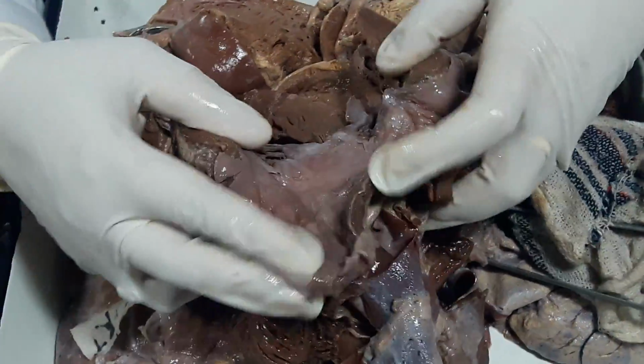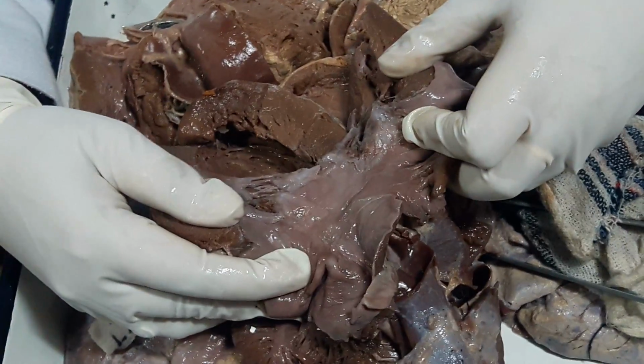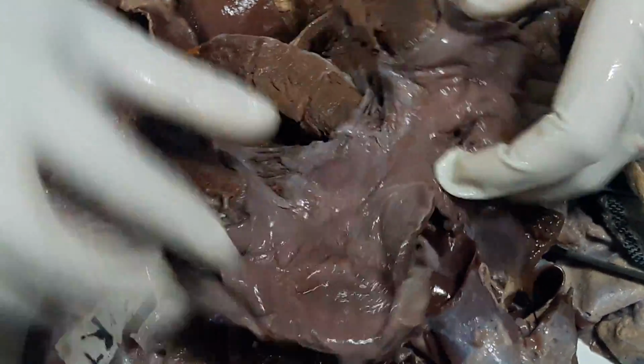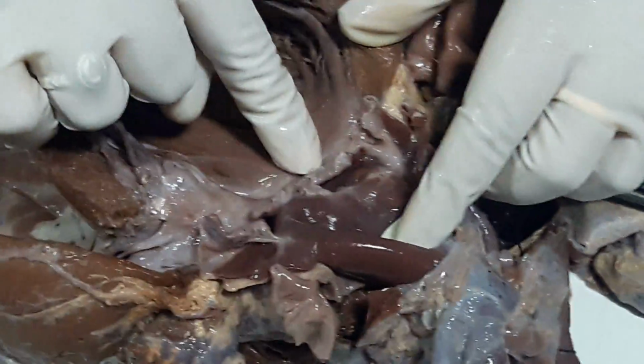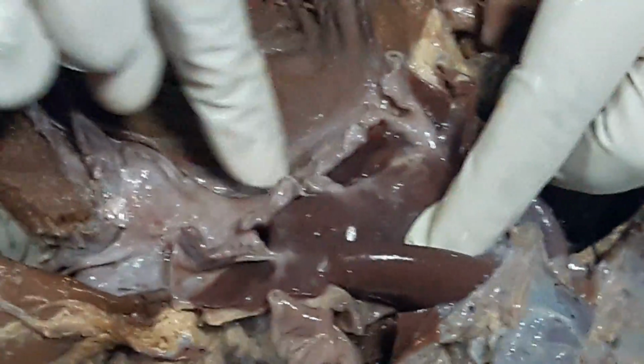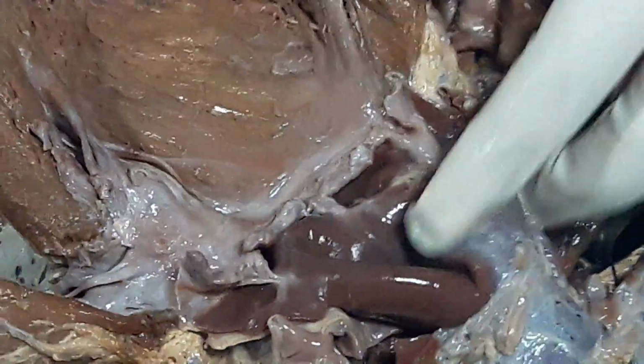Again, you can see the left atrium is mildly dilated and mitral valve is thick. The chordae are thickened, they are shortened, okay, they are fibrosed. You can see the chordae are adherent, and the aortic valve is also showing involvement, okay. There is irregularity, the cusps are retracted. So there is involvement of both the valves in rheumatic heart disease, okay.